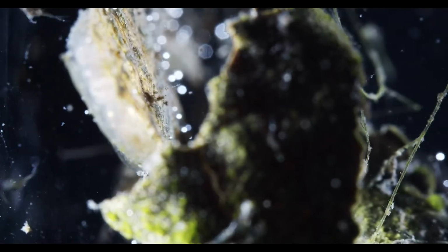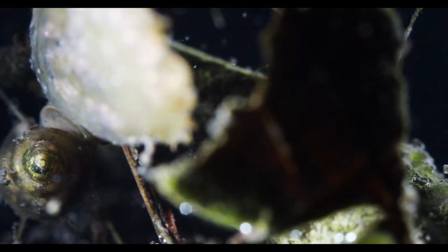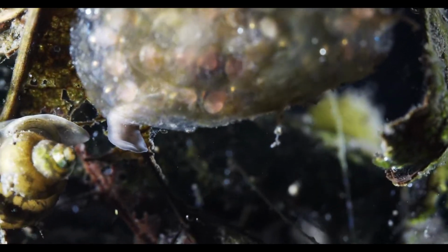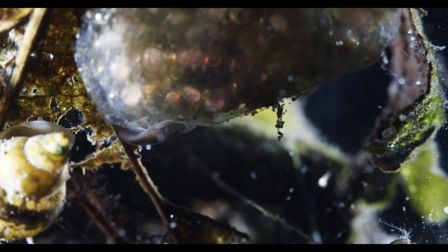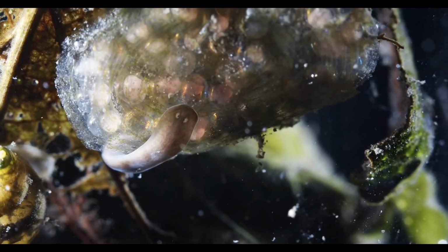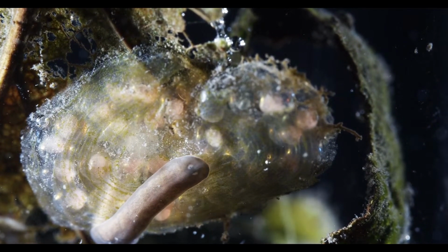No, he's not coming out the other side, eh? No. There he is. Oh man, the setup is, at least for snails and flatworms, very nice to really just follow them around.